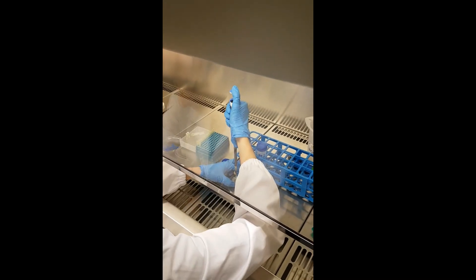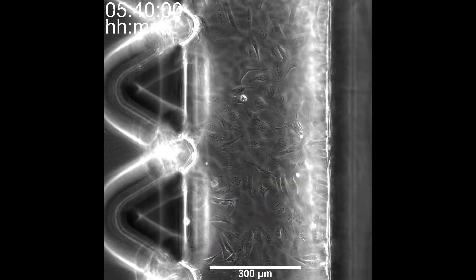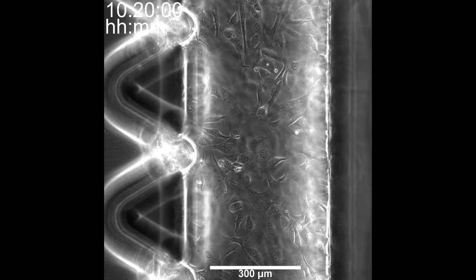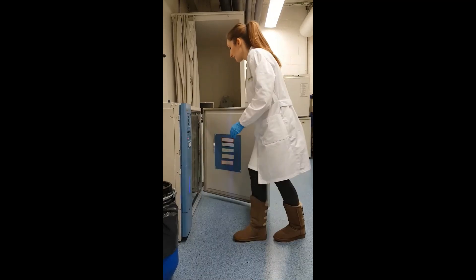Now, time to add the endothelial cells. Then they proliferate in the incubator during hours and days to get ready for the test.